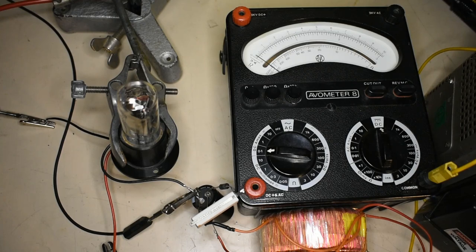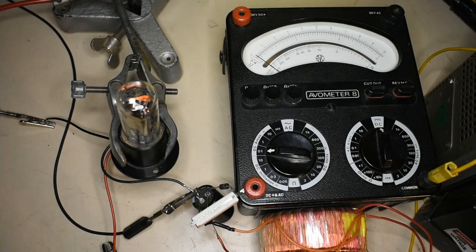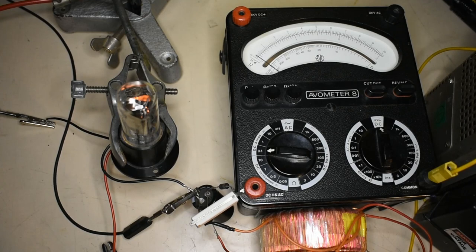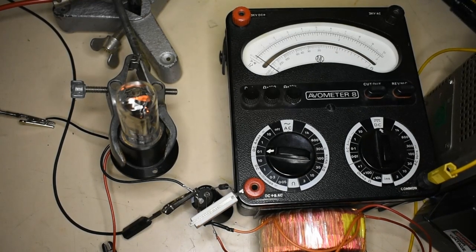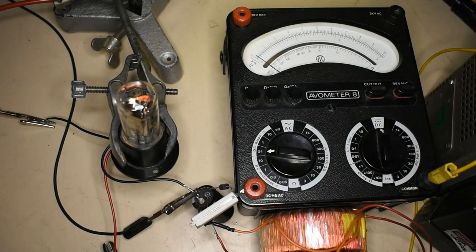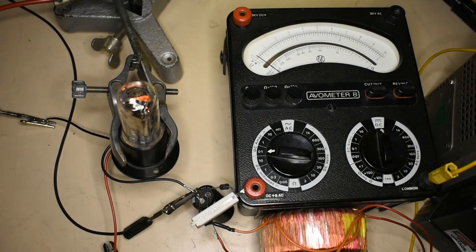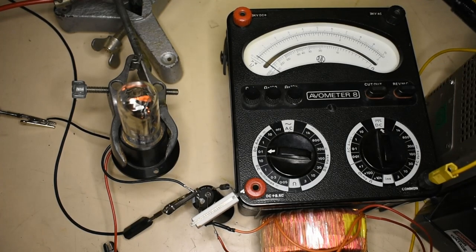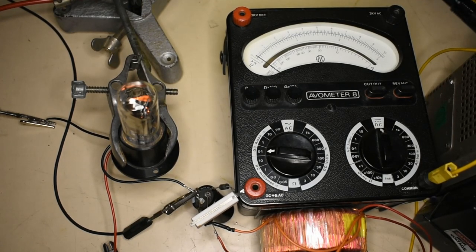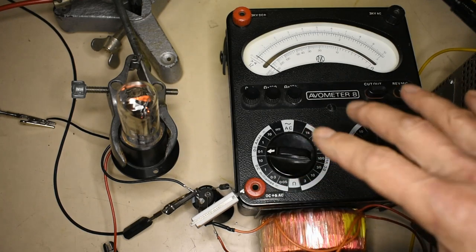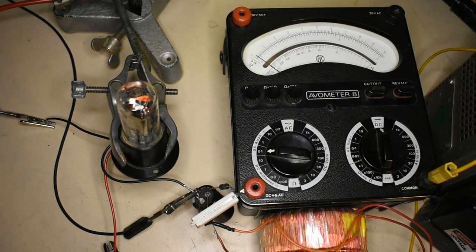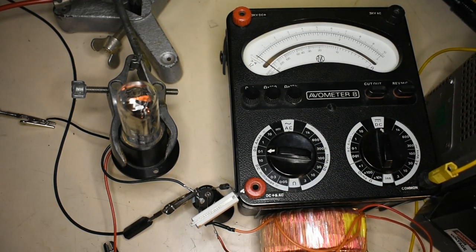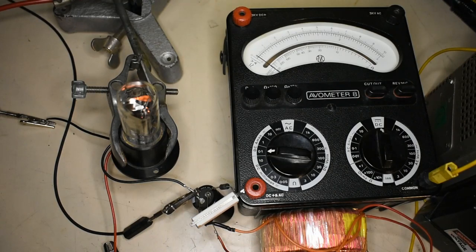I can bring up the voltage on that until the cathode starts to glow. You may just be able to see that about there. Once the cathode's glowing we can then apply our anode voltage which I'll put about 120 volts onto it. Still nothing happens because we need to trigger it. We have a meter in series giving us the current that's set to a full scale of 100 milliamps.